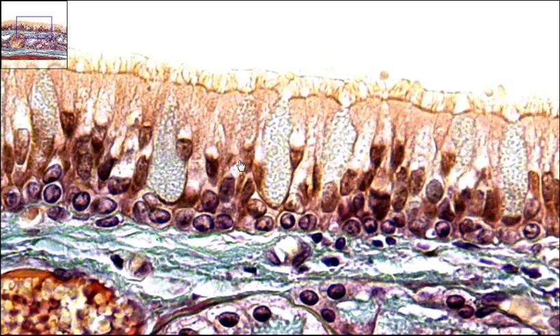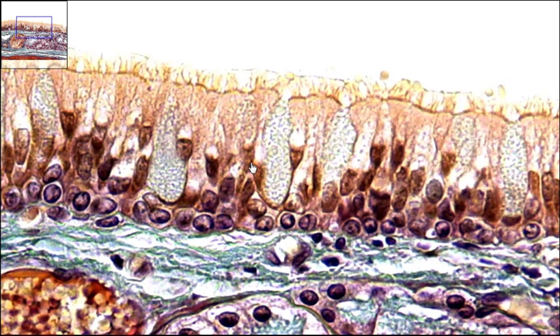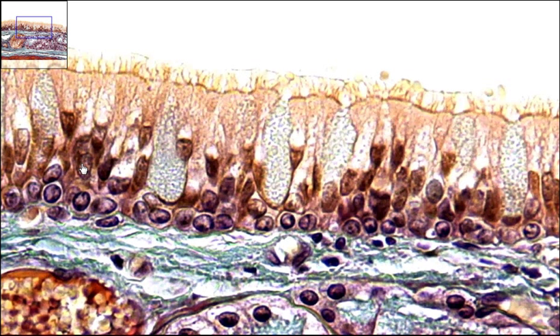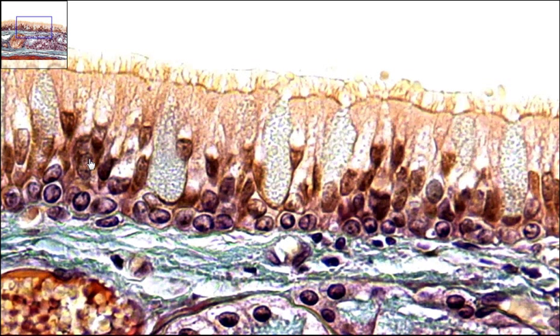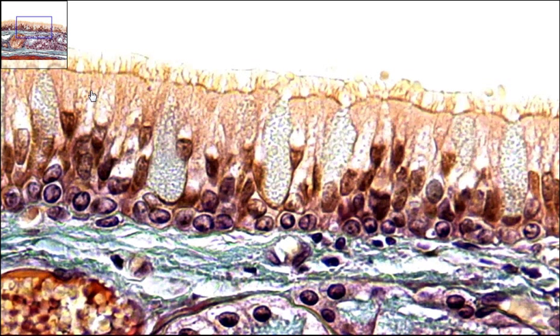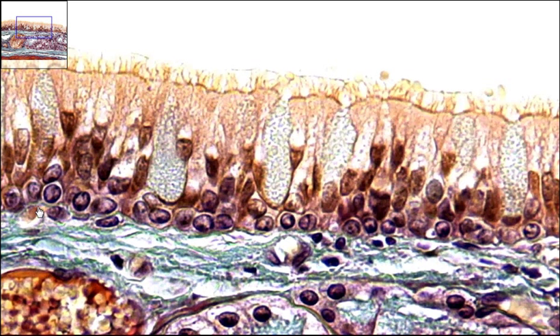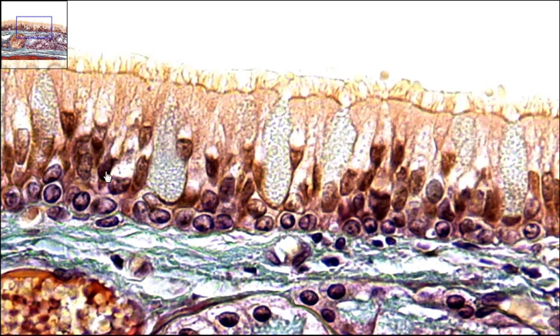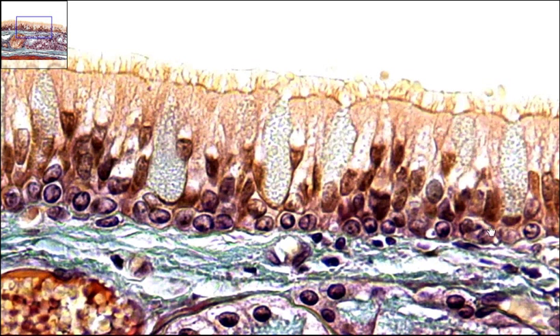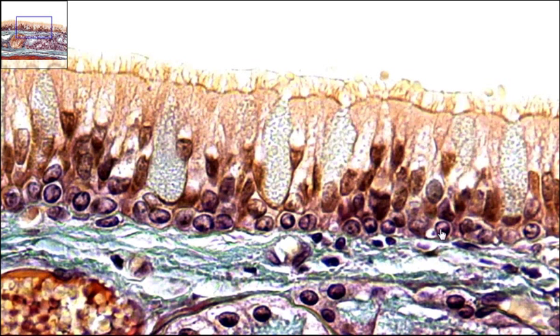These cells are your pseudostratified columnar cells. You can notice how these dark dots are the nuclei — they're all at different levels. That's because every single cell touches this basal surface, but not every cell makes it up to the apical surface. Some cells just stop before they even reach the apical surface.